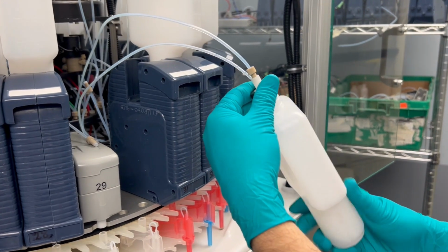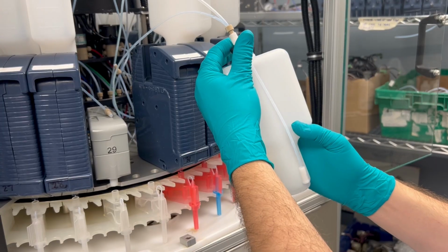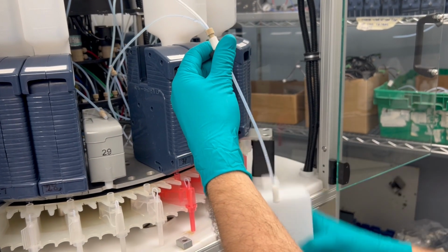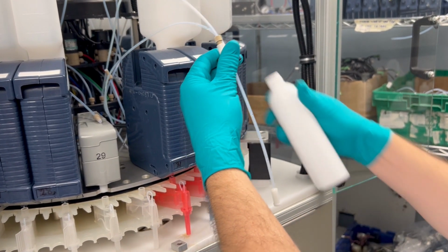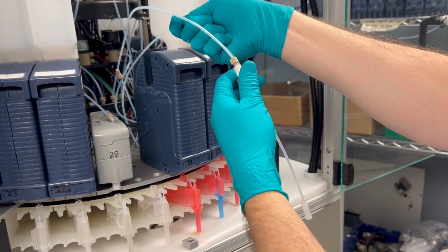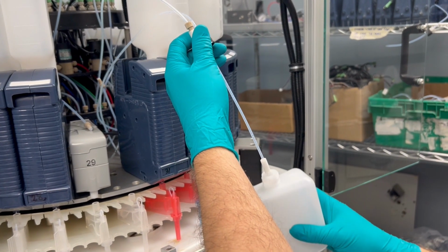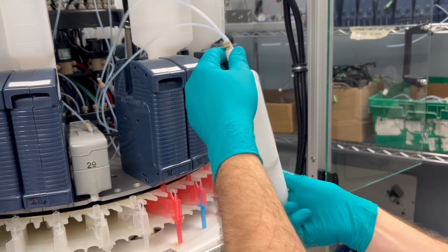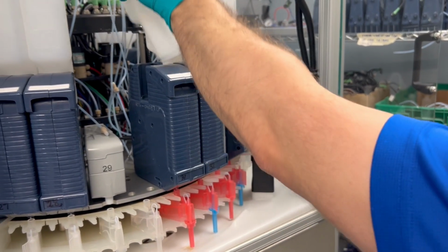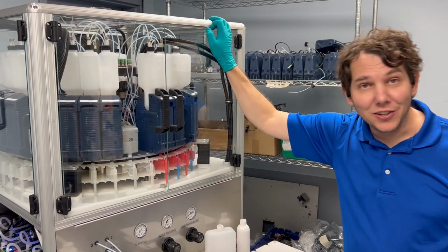So to open and change these bottles, you will simply just remove them. And as you'll notice, this has a specific dimension for that size. If you are going to have a different size, it will require just slightly pulling up this tubing to make it match the bottle that you're using. And swapping out the bottles is just as simple as rotating and you're done. So next we're going to go ahead and look at the externals.